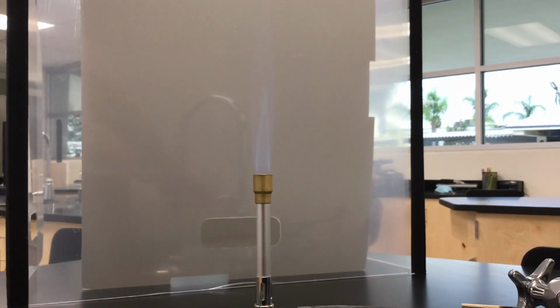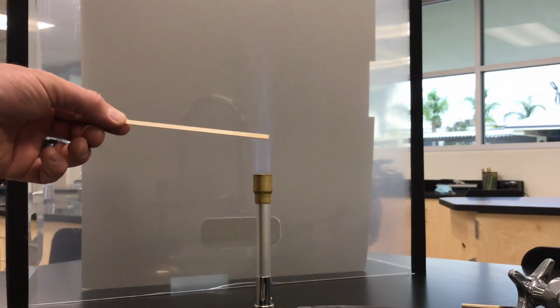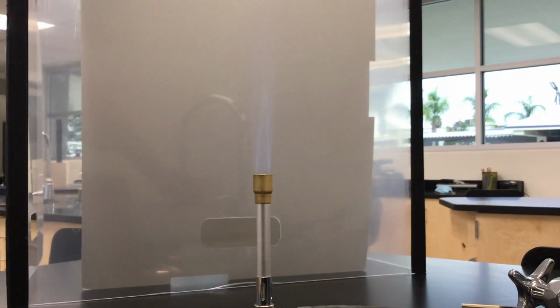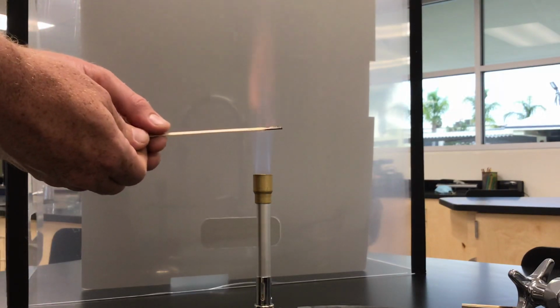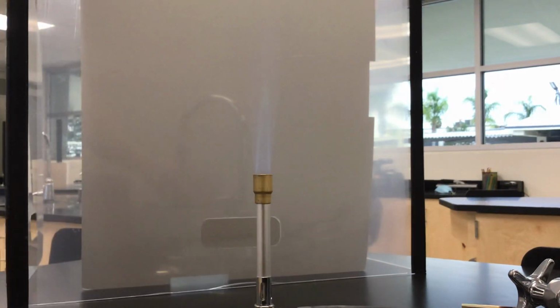This next one is going to be calcium. So underneath the solution, you can write calcium. So be as descriptive as you can, because there's going to be a couple that are a similar color. So calcium. All right, that's calcium. Let's do another one.